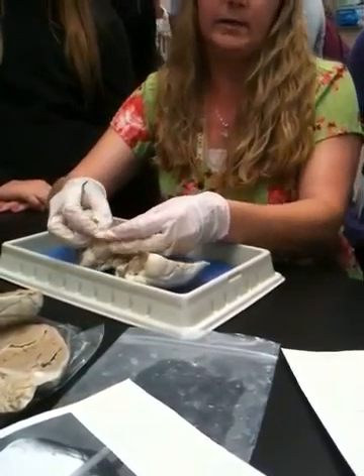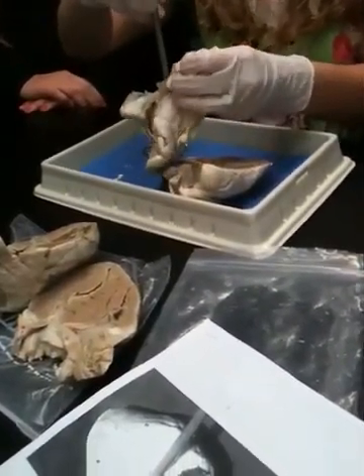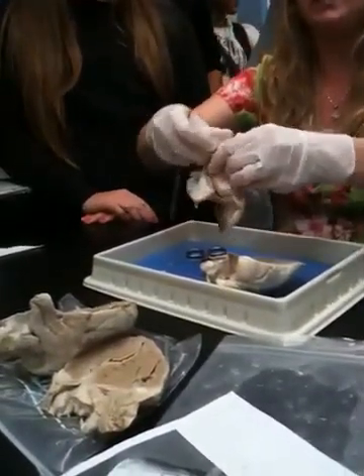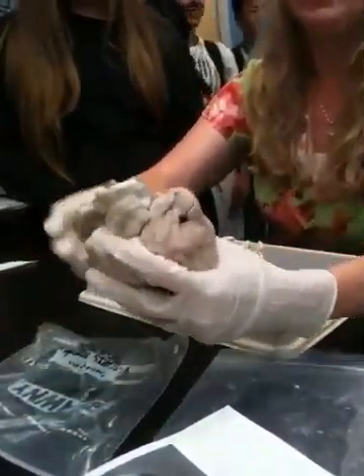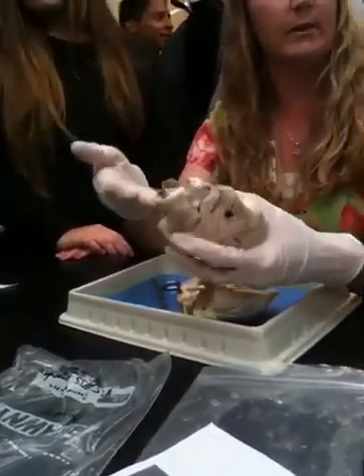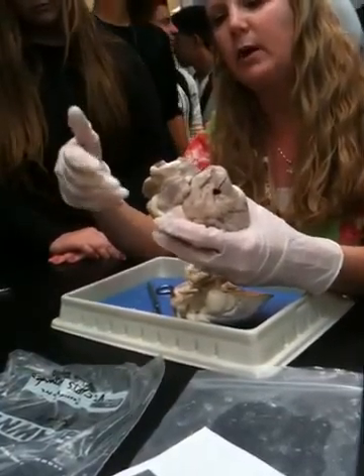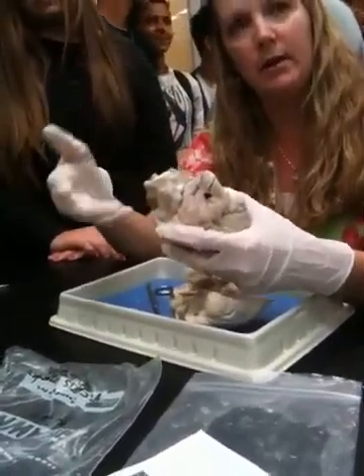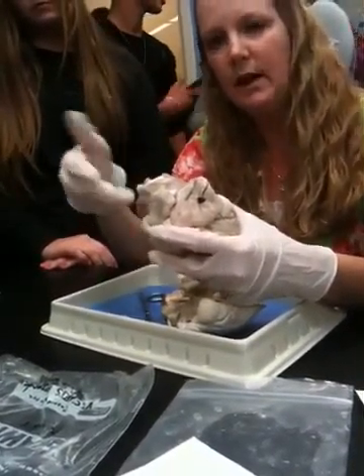This right here, see where I cut this? I cut this part actually. That's the superior. Oh, there it is. Most of you guys didn't have this whole entire flap on yours. Most of you had tons of fat, same as this one, where it's all cut off right there. So the only thing you really see is an opening to the whole entire atrium, or the auricle, I guess I should say. And guys, you're not going to get marked off if you write atrium instead of auricle, because they're about the same thing. Not technically, I guess, but it's not going to be marked off if you write atrium instead of auricle.